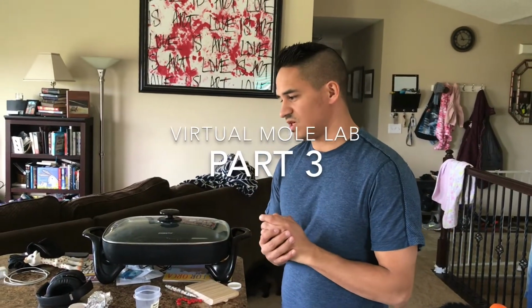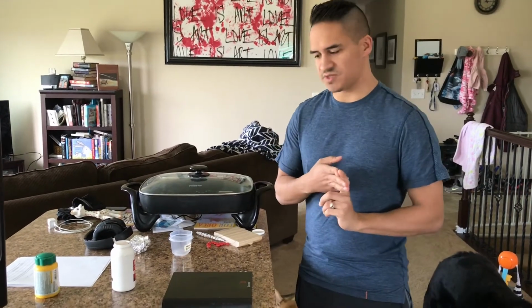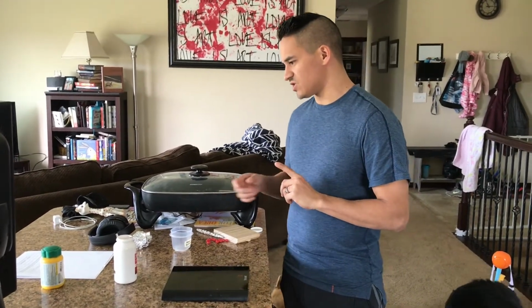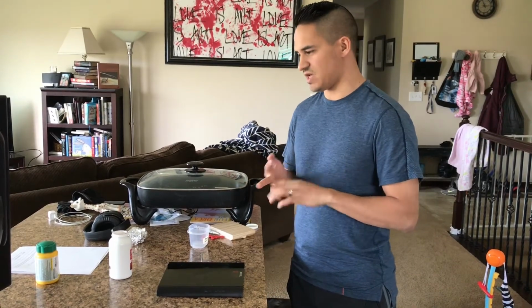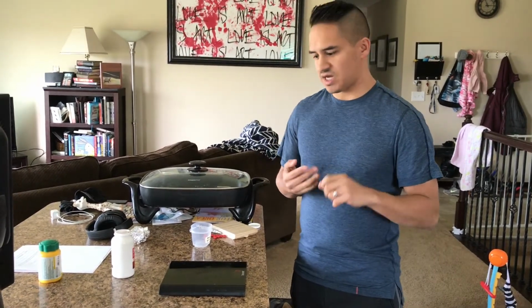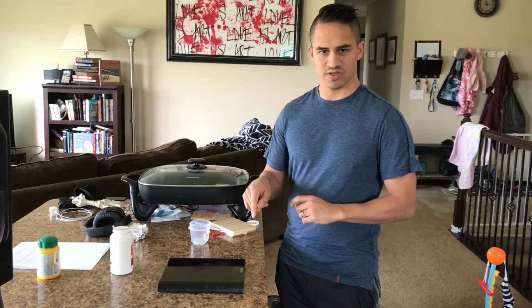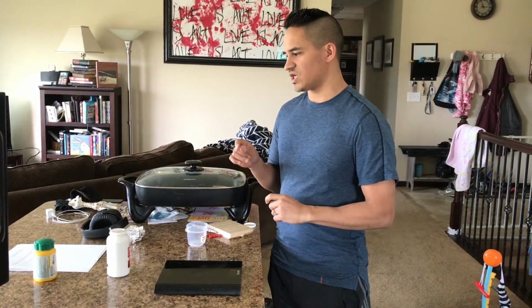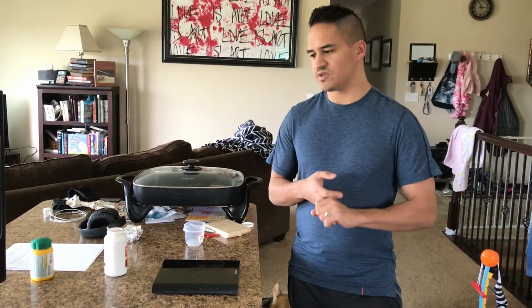This is part 3 of the virtual mole lab. In this part, we are going to be measuring out 3 different substances: some aspirin tablets, a piece of wood, and a piece of aluminum foil. Your job is going to be to record the masses of each of these items, that's going to be shown on the scale. And then from there, you're going to calculate the molar mass of each material and the number of moles of each material, and then use that information to solve the last problem for part 3.